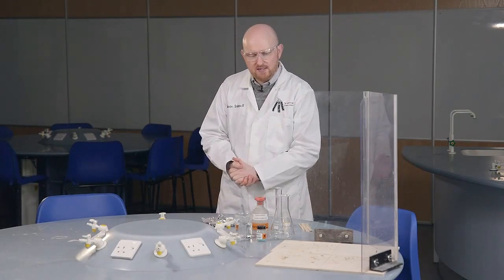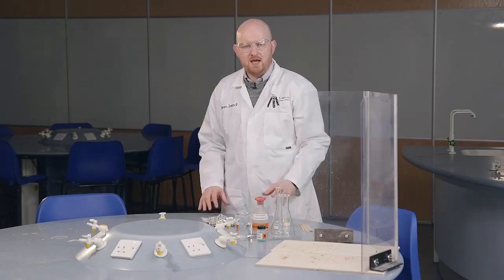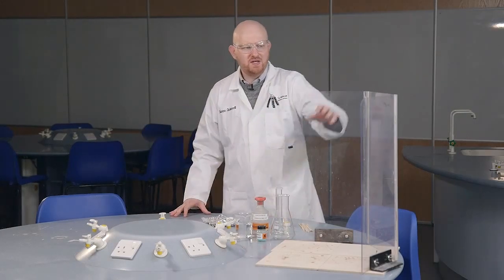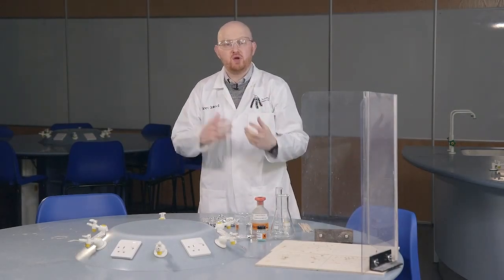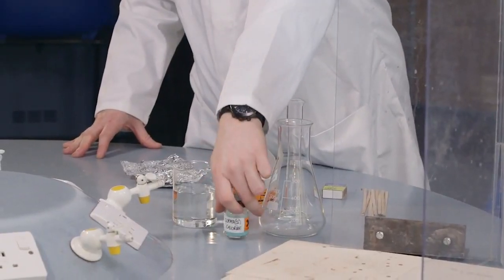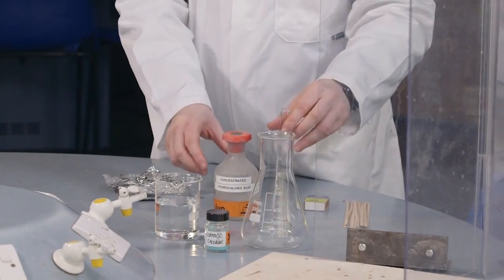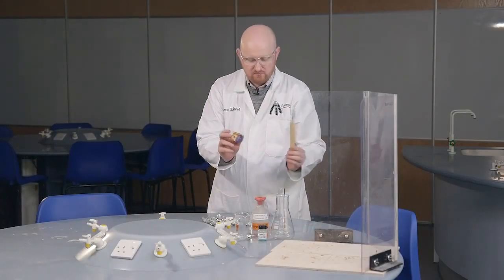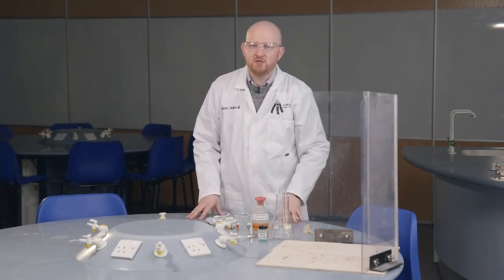So if we look at our Northern Lights demo, this is the setup we have. We have some heat-proof mats and a safety screen. Now, if you're doing this to an audience and the audience needs to be about 3 meters away, you do need a safety screen on each side. So one for you as the presenter and one in between the demonstration and the audience. We also have a conical flask, around 6 grams of copper 2 chloride, 200 mils of water, a measuring cylinder, some conc hydrochloric acid, and some splints and matches to light our Northern Lights, and some aluminium foil. So they're all the different bits you need for this demonstration.